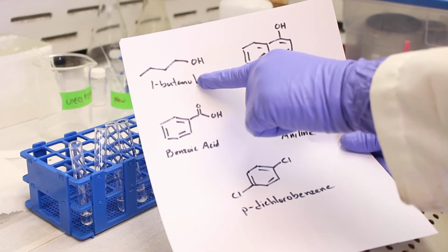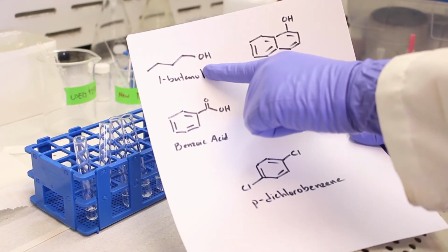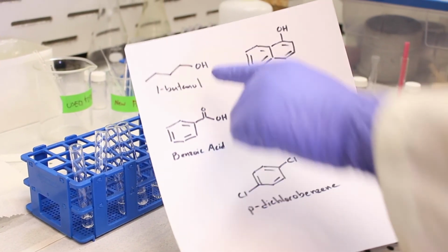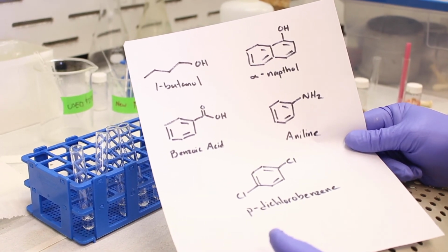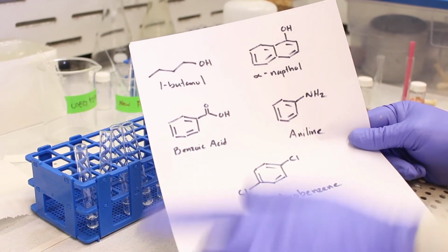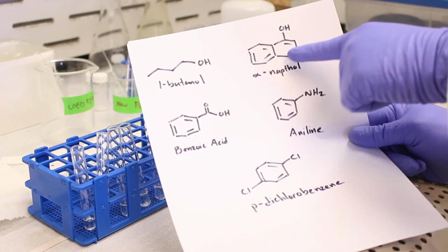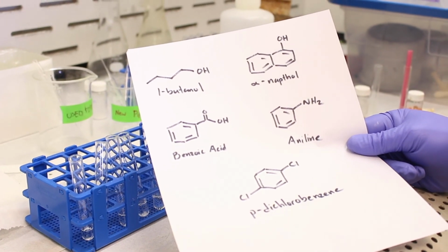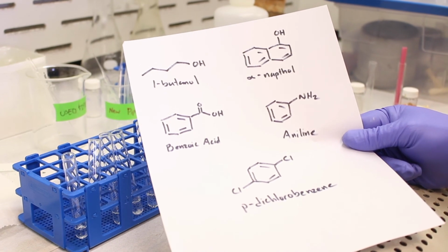Just to briefly recap what we covered, we'll go by the functional group. In 1-butanol, which is an alcohol, the key takeaway is that these are soluble only in sulfuric acid. Alcohols tend to fall under the neutral functional groups, which tend to be soluble in sulfuric acid. Naphthol, which is a phenol, so an alcohol attached to a ring, is a weak organic acid, and these dissolve in strong bases only. So only in sodium hydroxide do they dissolve.